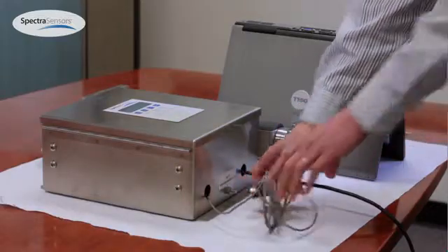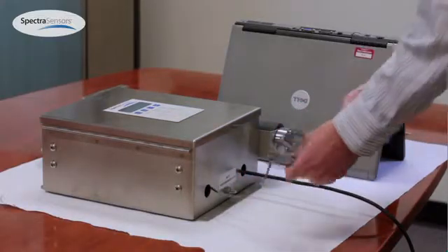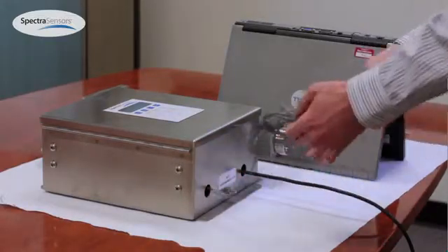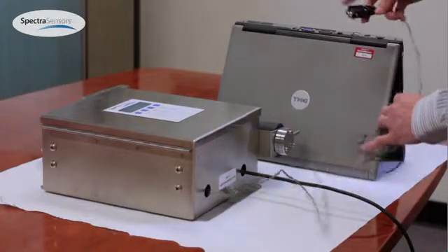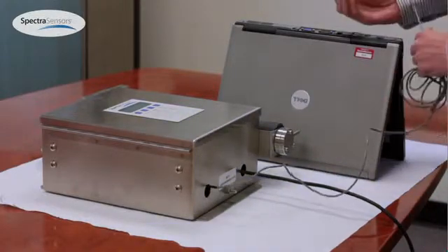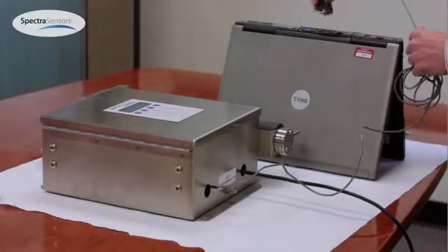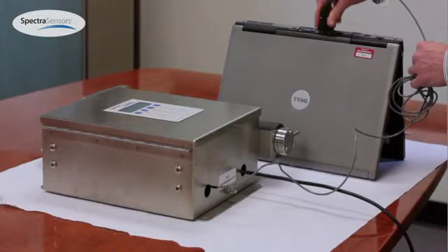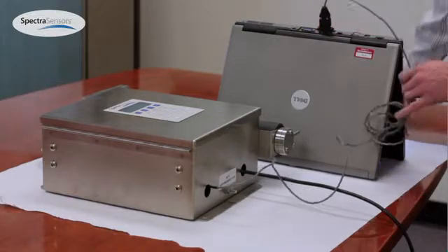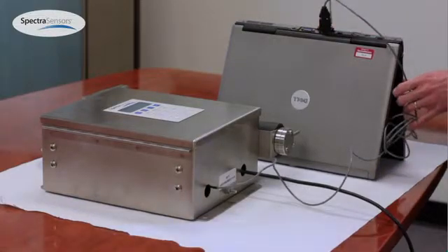Once the connection's been made, uncoil your RS232 cable, connect to your laptop, secure it appropriately.